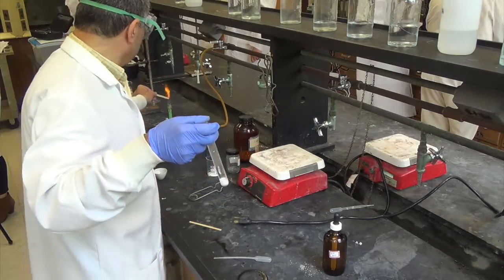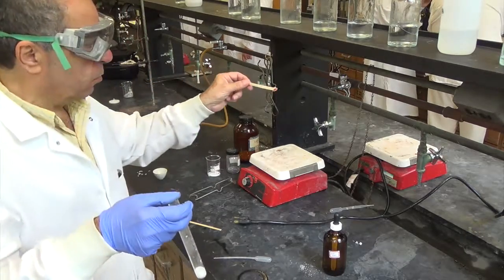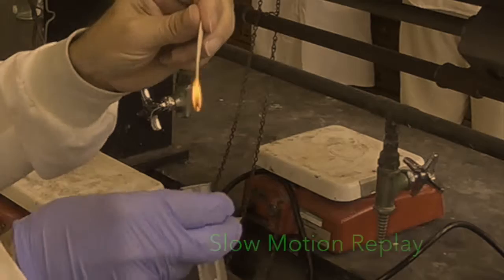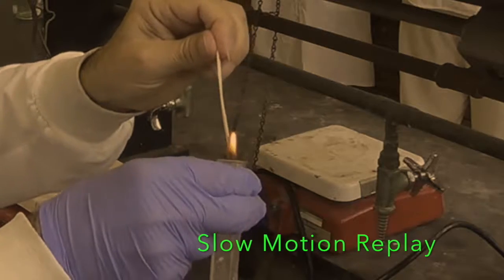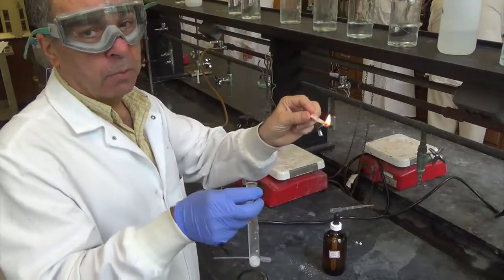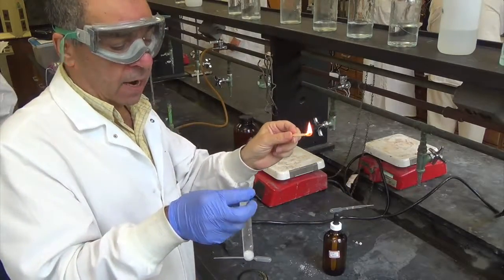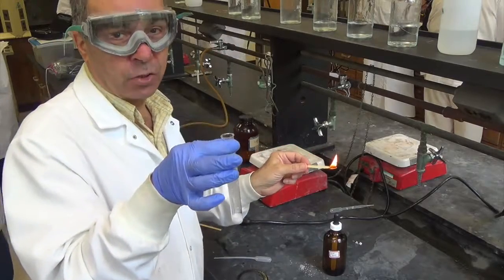If I put a burning splint in there, we'll see what happens. The popping noise refers to the fact that the gas evolved here is hydrogen gas.